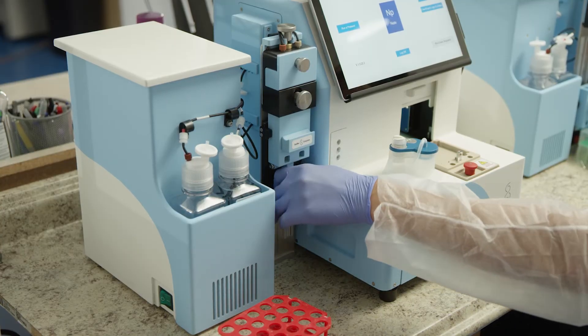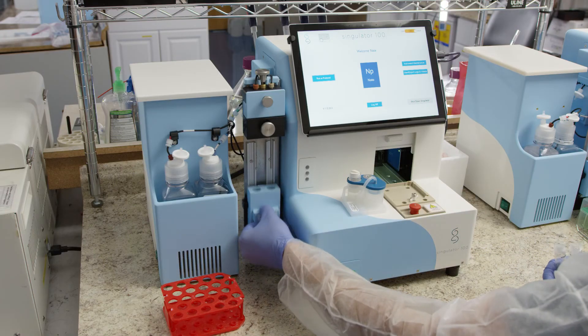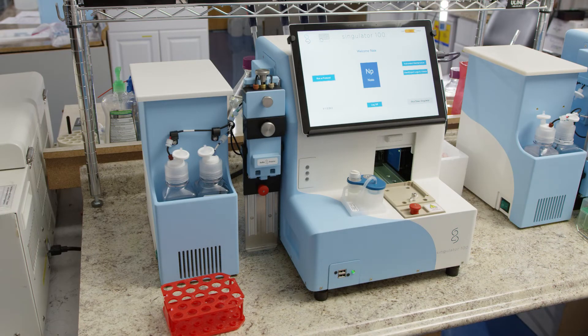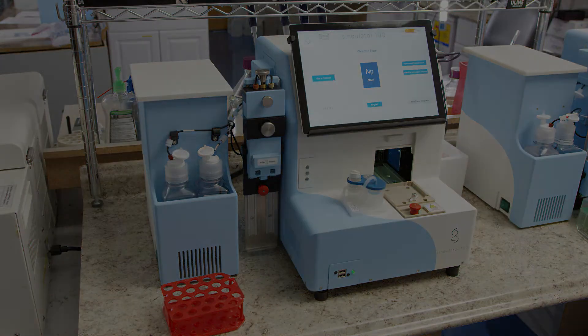pull out the red knob on the single shot mechanism and lower the reagent delivery stage. Pull out the blue handle to tilt the reagent tubes toward you. Remove the 15 milliliter conical tubes and dispose of properly. The tubes will contain waste water from the automated rinse procedure that ensures the instrument tubing remains clean.